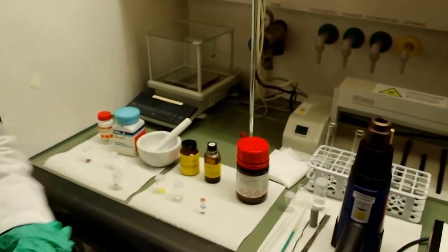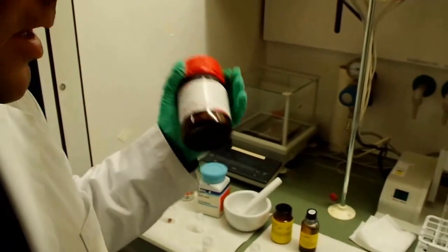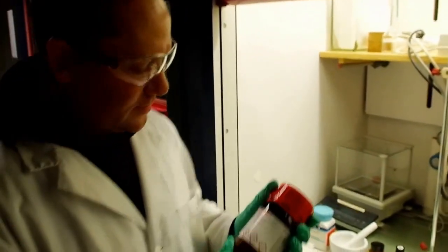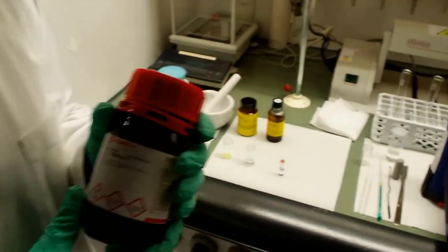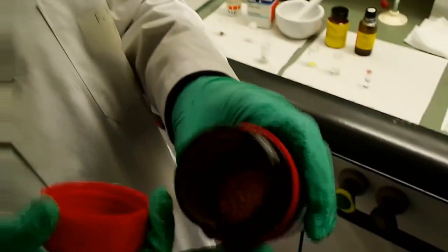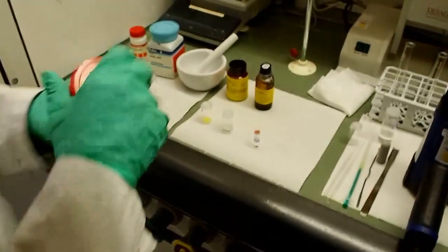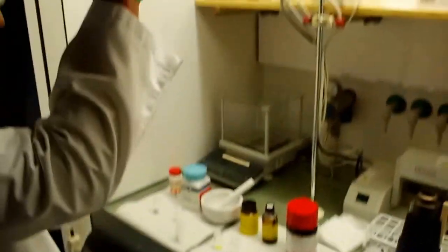And we need a solvent. Solvent in our case is alcohol. I mean not the alcohol which you think, guys, you can drink. No, it's an aliphatic alcohol. In this case we use tetradecanol. It has 14 carbons, but also in this case it does not matter. You can take 12 carbons or 18 carbons. It's a harmless chemical. You see it's a white solid stuff. Okay, here we go. This is our reaction vessel. Very simple, right? So, let's start the nano cooking.